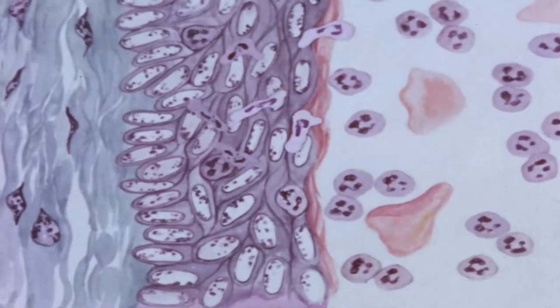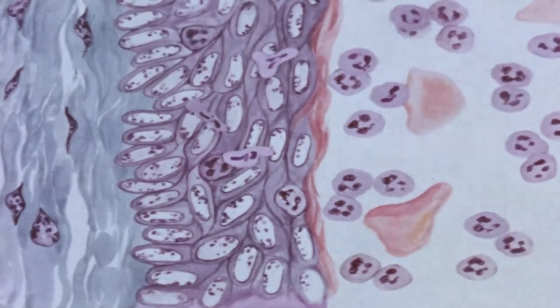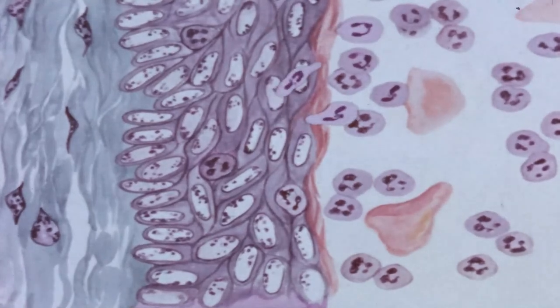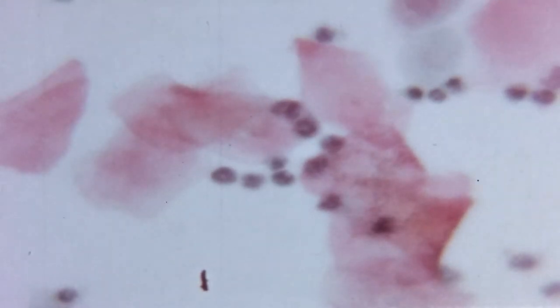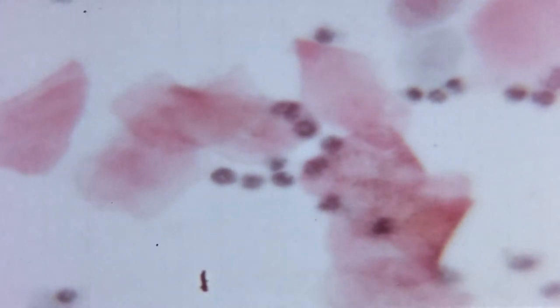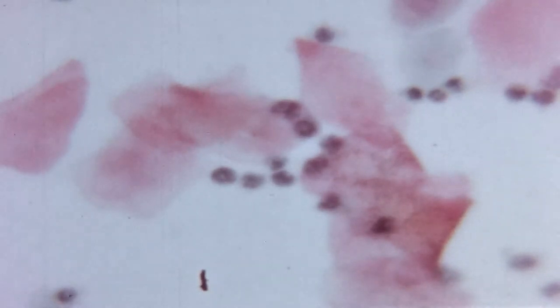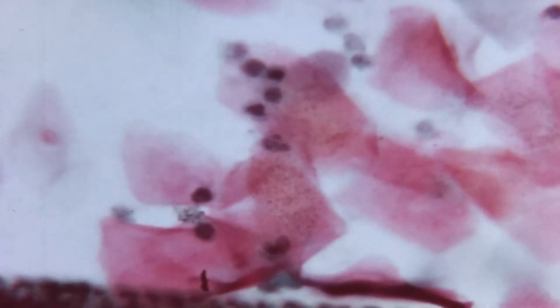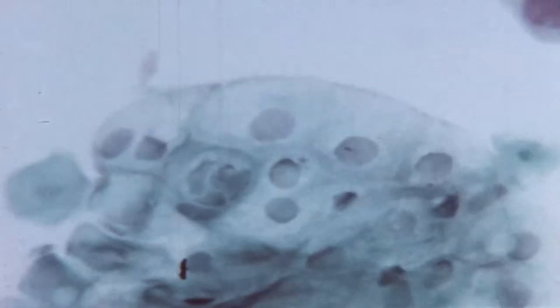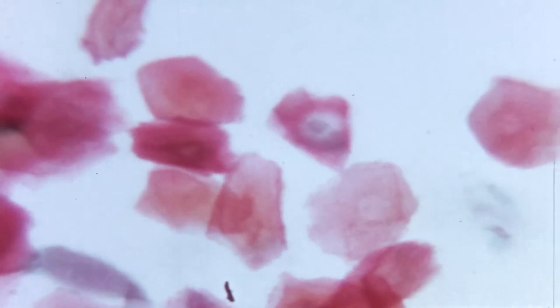Near the end of heat and for a period thereafter, leukocytes invade the superficial epithelium and large numbers migrate into the lumen. Thus the smear will again show the cornified cells, but in addition large numbers of leukocytes will be present. After the period of heat, the superficial cornified layers slough off and are lost from the vagina. The changes in the vaginal smear during the cycle are only of relative value in accurately determining the time of ovulation and various other reproductive phenomena.